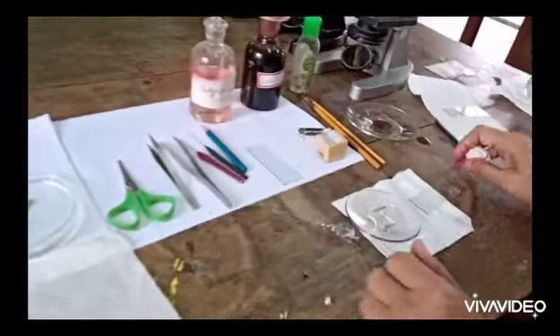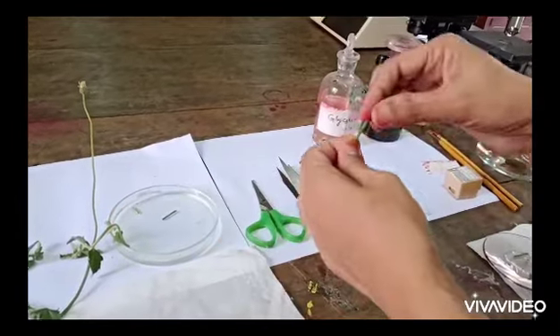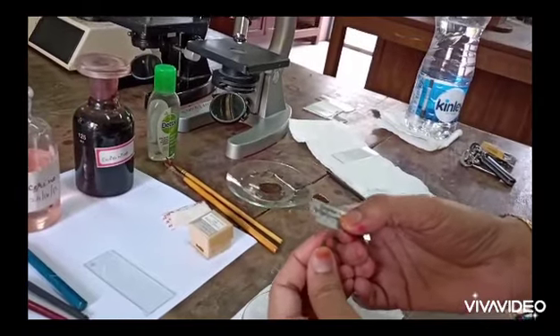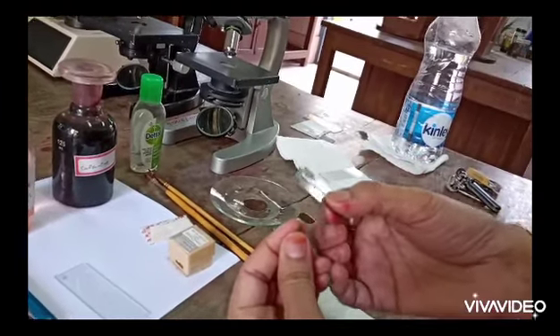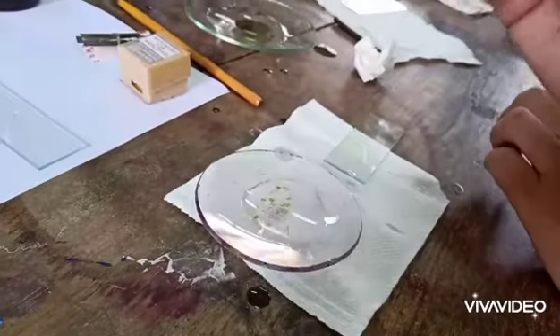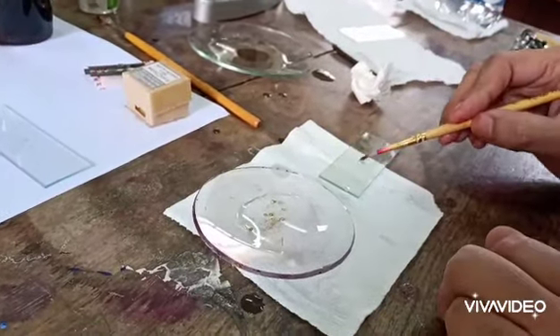So now let us see how I am taking the sections. Take a new blade and take a piece of stem. Hold the stem in the left hand and the blade in the right hand. Take the sections horizontally by slightly applying pressure. Now take the sections and put them in the watch glass containing water, then select the good sections.